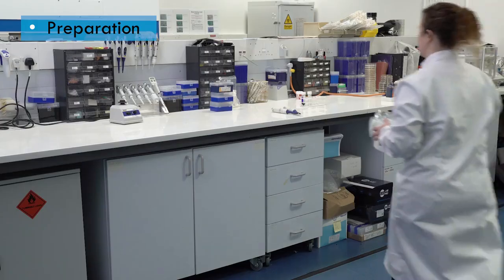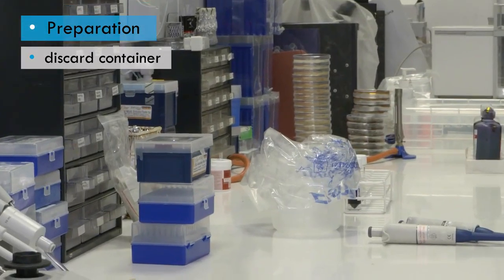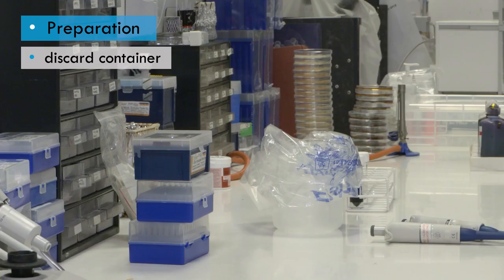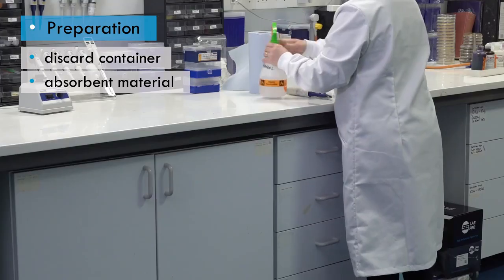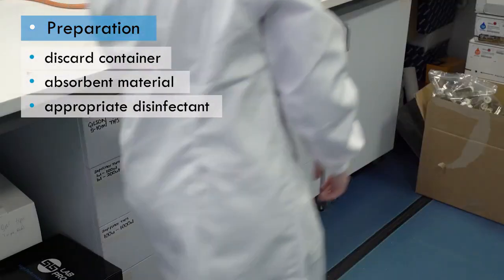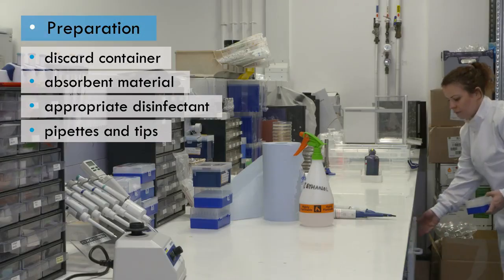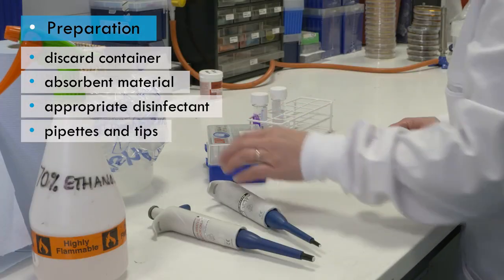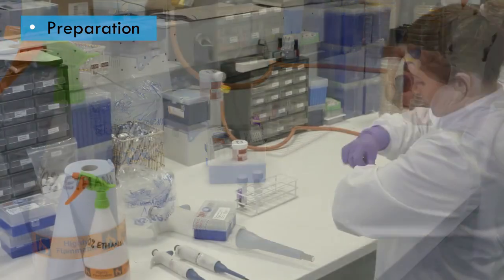Gather together the necessary equipment. You will need a container for discarded pipettes and tips. This could be a bin, box, a bag or a jar. You will also need absorbent tissue and an appropriate disinfectant to deal with spills and contamination of the pipette. You should have enough of the right pipettes and pipette tips for all of the work you are doing, and a few spare, so that you don't have to interrupt your work to fetch more.